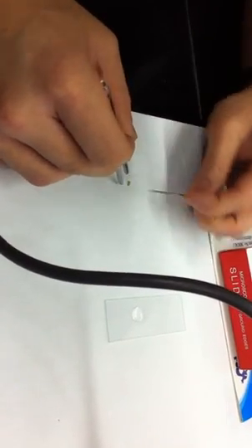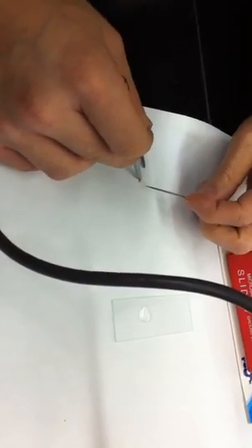And then put the body on. Oh, he's not? Hurry up before you slice. Oh, just use a tweezer to take a look at it.